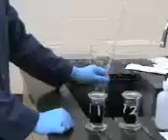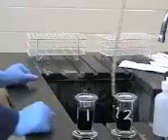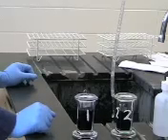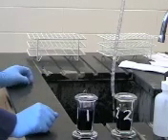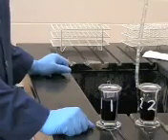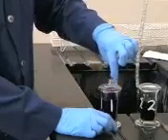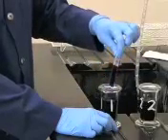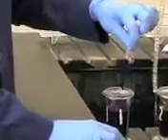This is going to stain your bacteria. It's going to stain all the bacteria, your gram positive and your gram negative. It's going to get inside the cell's outer membranes or the cell wall and just kind of stick there. So thanks to the miracle of video cameras, it's been one minute that it's been staining. So what you're going to want to do is take the paper clip and take it out and let it drain right on the side of the cup just to get any excess stain off.